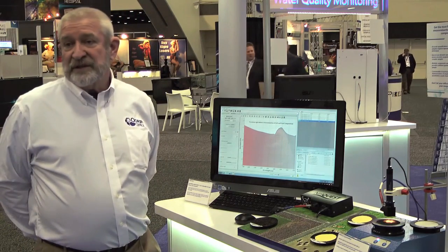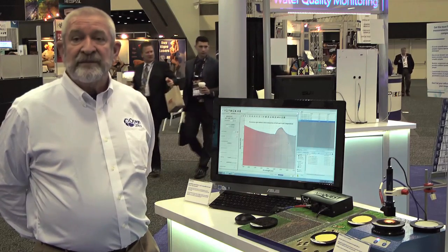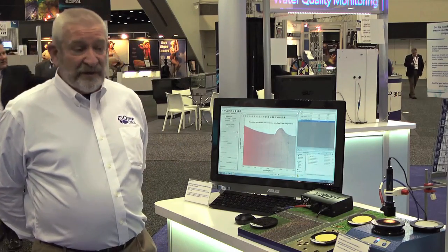We just look at a lot of different locations in the dirt and average it out. So now we're going around a circle, taking 20 spectra, averaging them, and now we're getting a good average of that sample of soil.